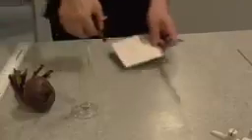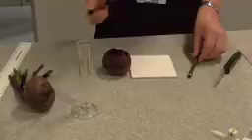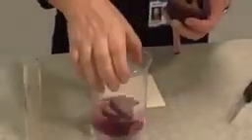Right, now your next job is that you're going to use a cork borer, or you could use a chipper here, but basically you need to make yourself some evenly sized chips of beetroot tissue. So a good way to do this, you can see I've been busy on this one here, is to use a cork borer. Simply cut yourself some nice little cylinders of beetroot tissue. You'll see there are some I made earlier. Give them a little rinse a few times in fresh tap water. That will remove any excess anthocyanin that's leaked out from the damaged cells.